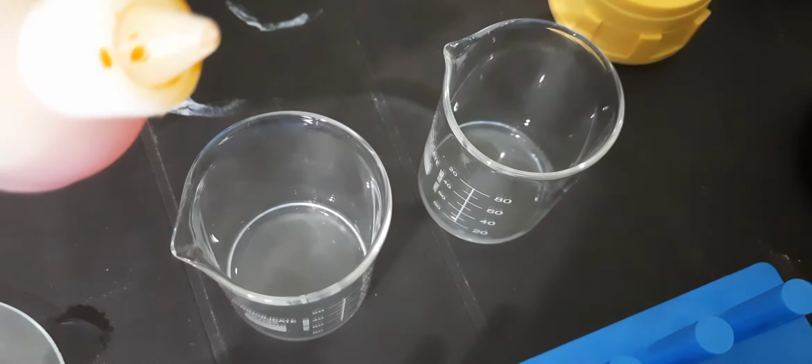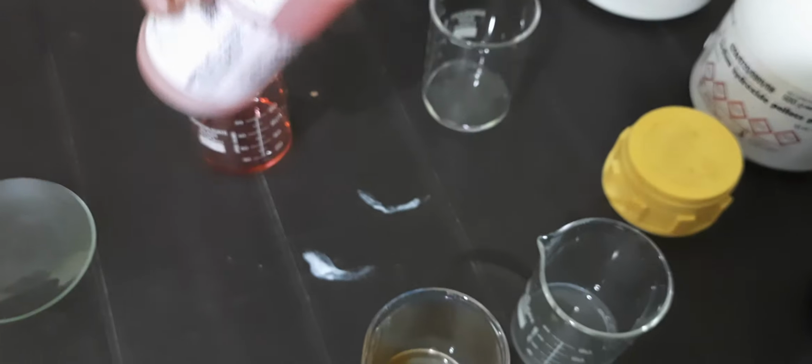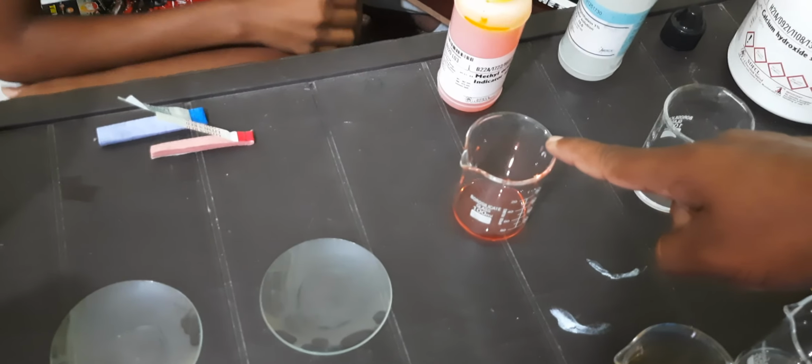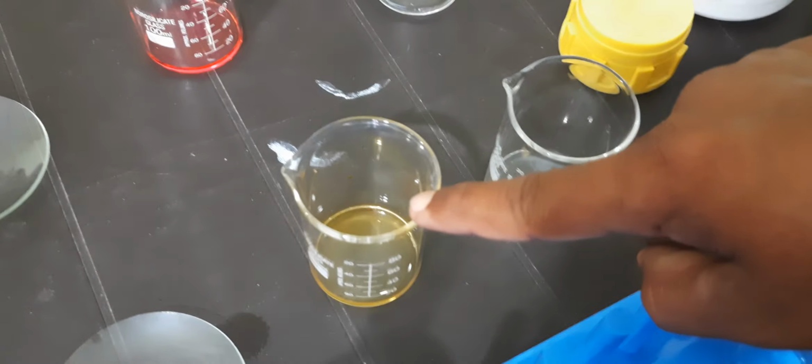Okay. Now take the same methyl orange in base. 1 or 2 drops, just leave it. Wait a second. Now what is the color of methyl orange in basic solution? Yellow. So you are observing practically, you should never forget this, the response of different indicators with acids and bases. So now finally we will conclude that methyl orange turns acids to red and bases to yellow.